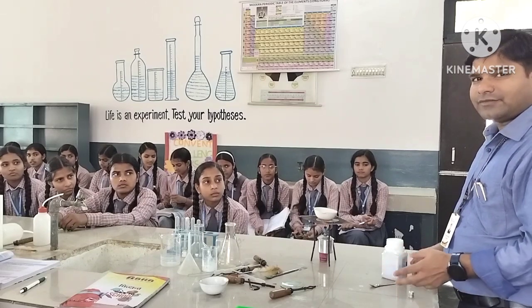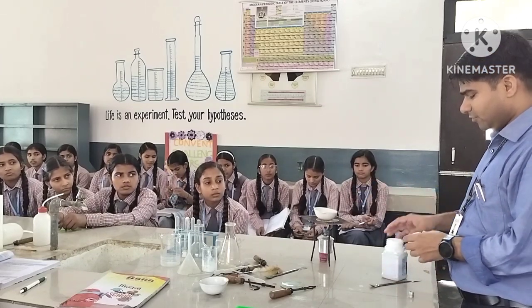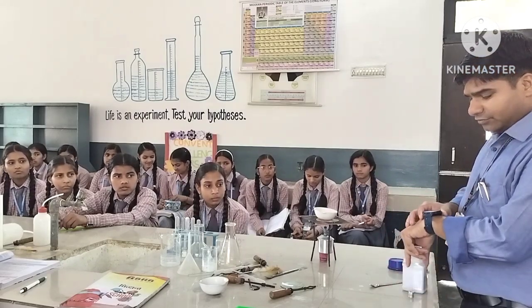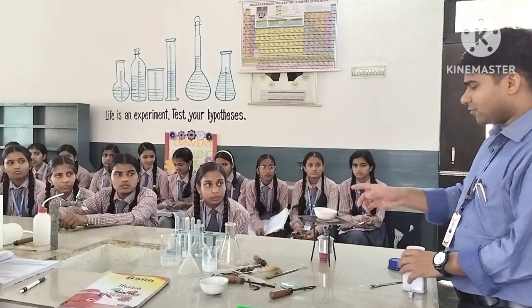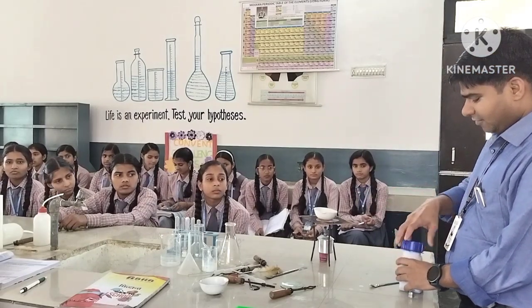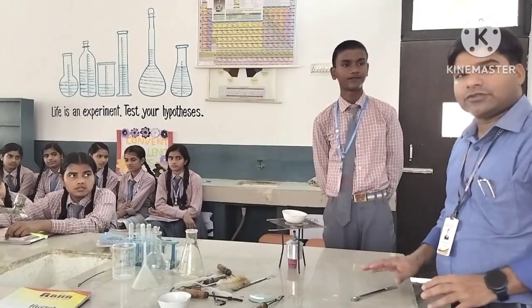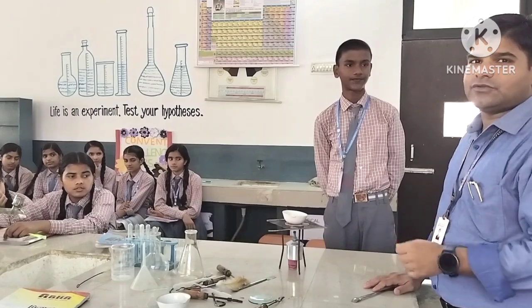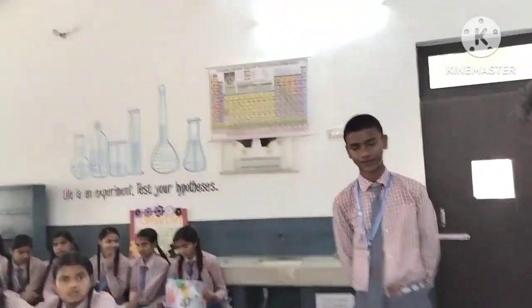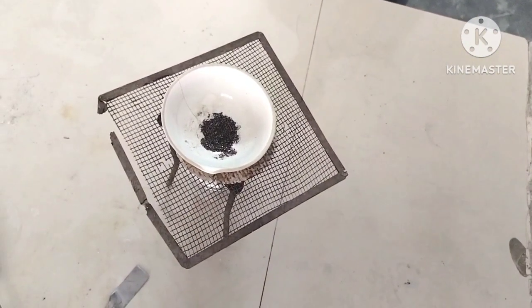You can see that copper powder will change its color. After about 10 minutes, you can observe the color change clearly.